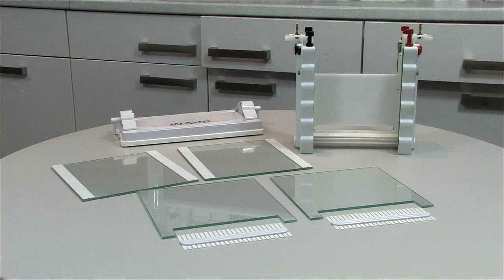Here's what you will need: gel casting and running upstand, casting base with mat, two plain glass plates with 1mm bonded spacers, two notched glass plates, and two 1mm 24 sample combs.